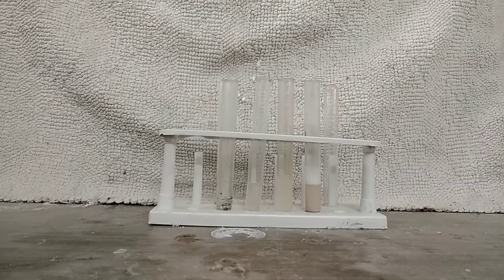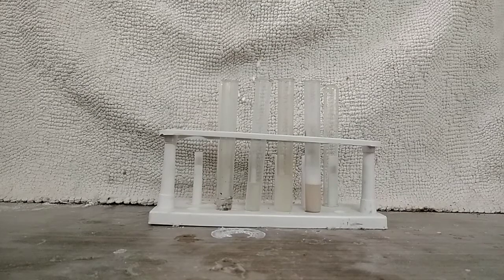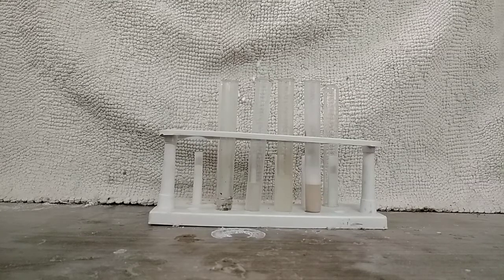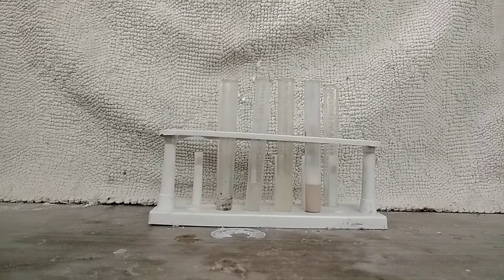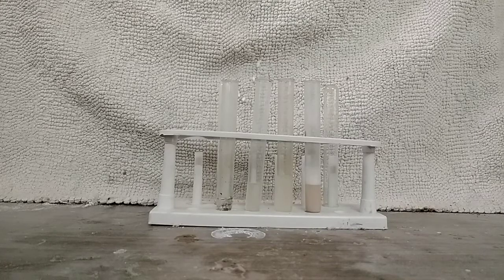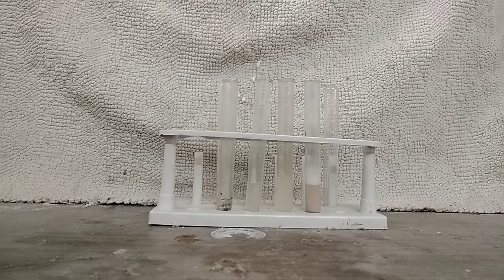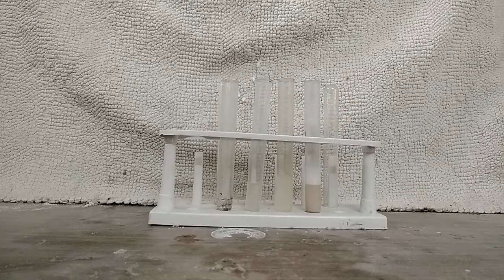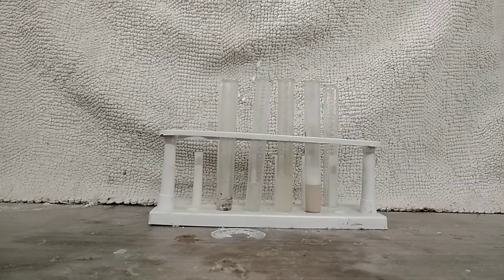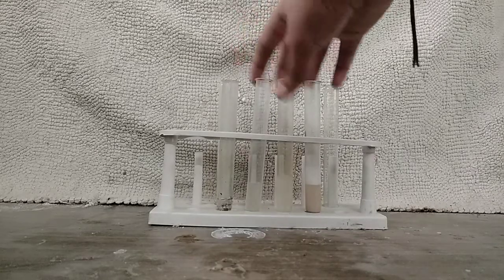Hello friends, today we will be testing some toothpaste for fluoride ions. You must have read that fluoride is contained in toothpaste and is very beneficial for your teeth. Today we will be testing whether our toothpaste contains fluoride ions or not. For this reaction you will require basically these four things, which I have added in separate test tubes.